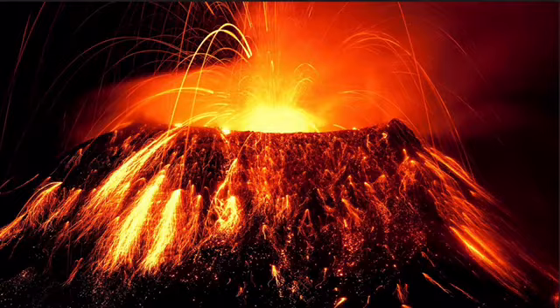Well, not this exact one. We will need a whole lot of natural resources to pull this one off. Instead, we will be using two simple ingredients.